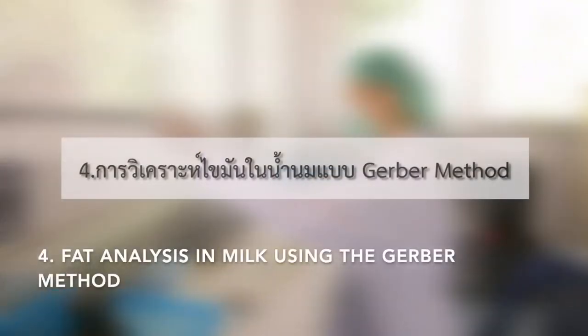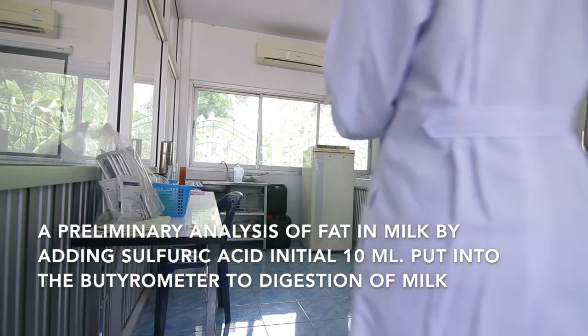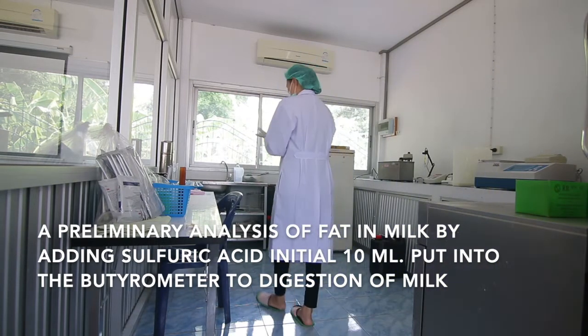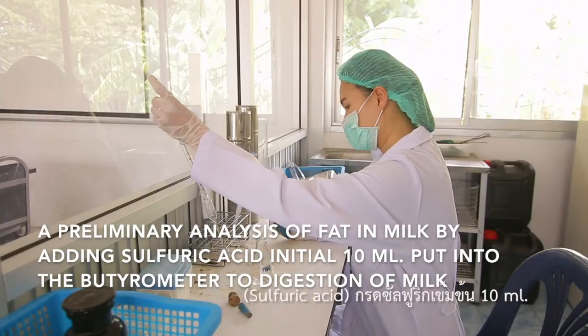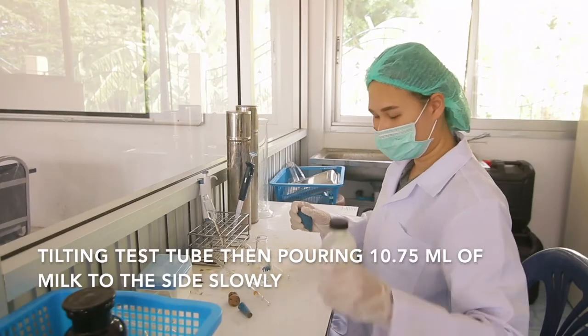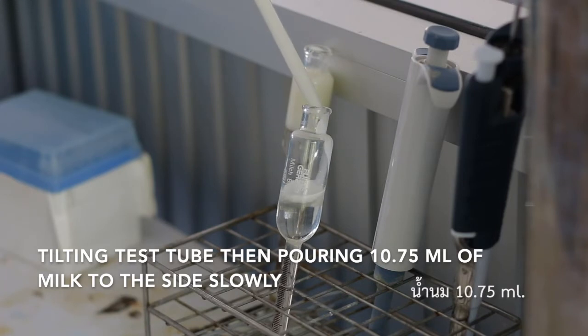Fourth, fat analysis in milk using the Gerber method. A preliminary analysis of fat in milk by adding 10 ml of sulfuric acid into the butyrometer for digestion of milk. Tilt the test tube, then pour 10.75 ml of milk to the side slowly.